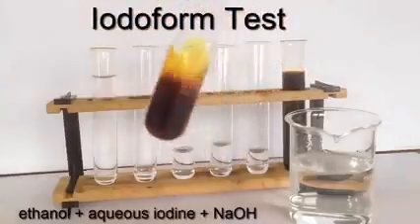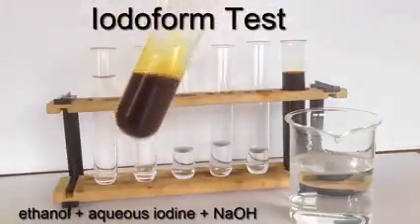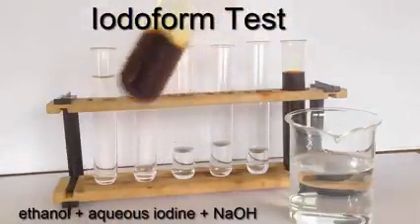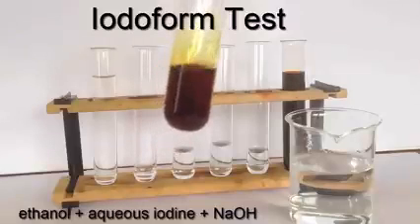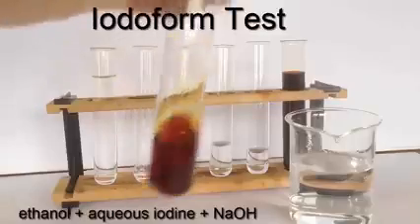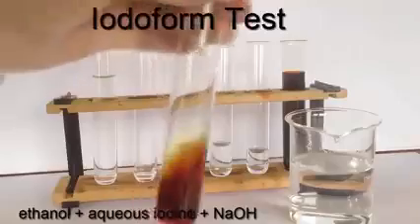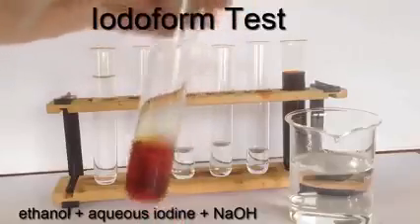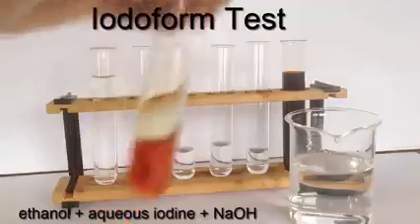So I'm going to add the sodium hydroxide and shake it. And you're aware then that the sodium hydroxide will react with the iodine, and from that reaction we'll produce sodium iodate(I), NaIO, which is a mild oxidizing agent. You can see the color fading there as the sodium hydroxide goes in.